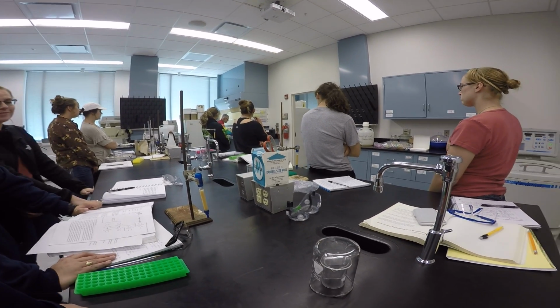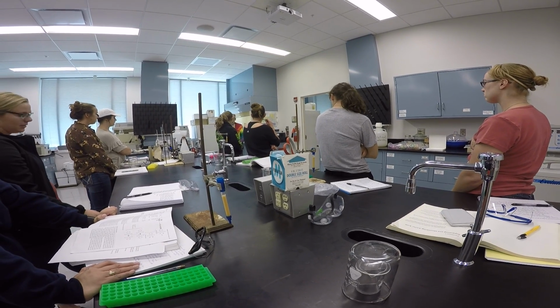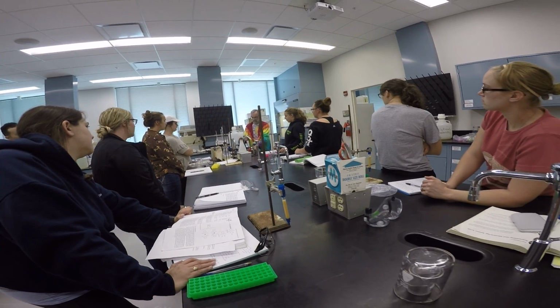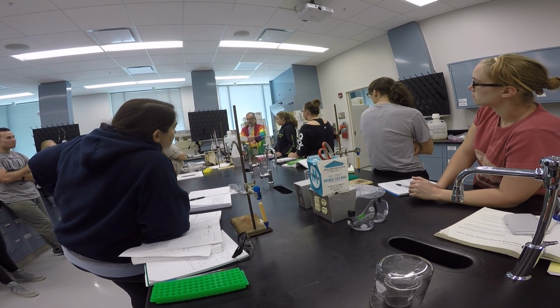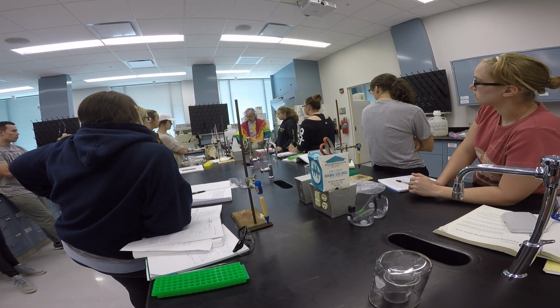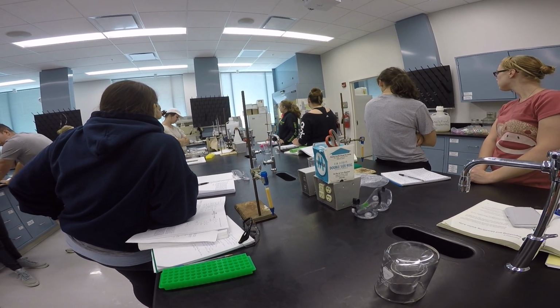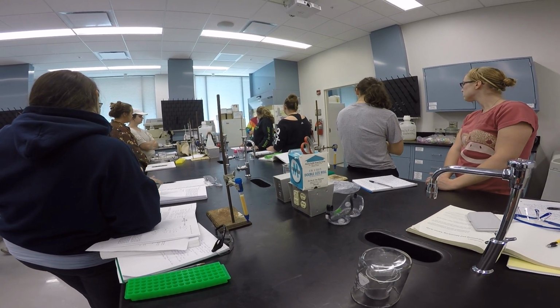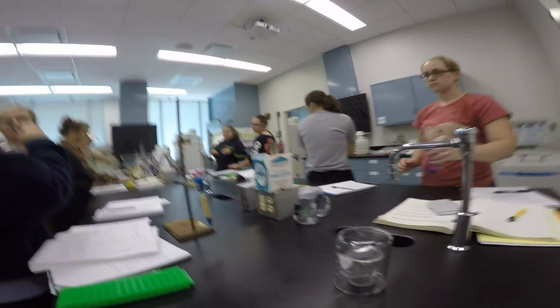Once you get that part done, the reaction itself takes a little bit of heat. So you come over here, put this on hot, and you heat it up until you get a reaction. Okay, we've got a couple tongs there, a couple more tongs over here. I think that's everything. Anybody have any questions? Okay, get your goggles on and let's get started.